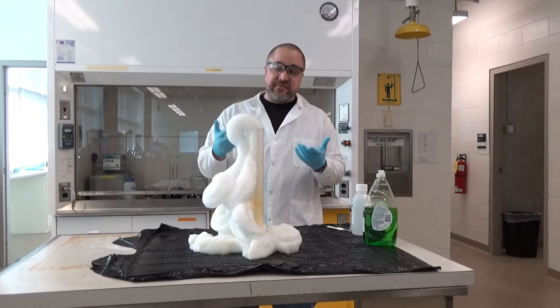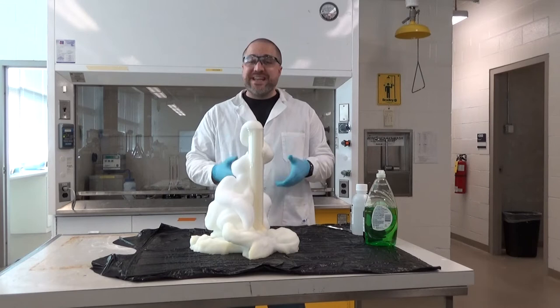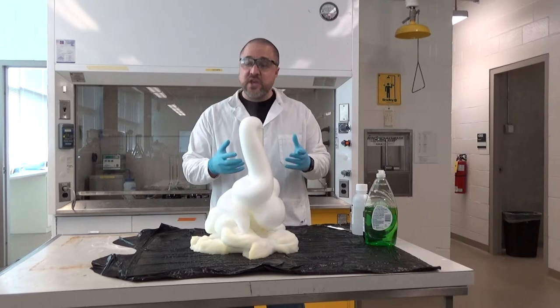You might notice there's steam coming out of this graduated cylinder. This is because the reaction is exothermic — it releases a lot of heat. I cannot touch the substance right now. So this is where our knowledge of matter and energy comes in again: we speed up reactions, but we have to understand what the end product is going to be so we can design things that are safe and efficient.